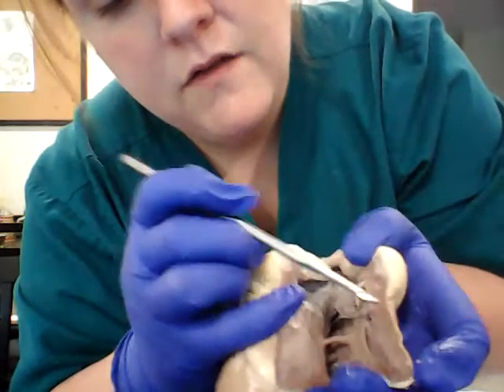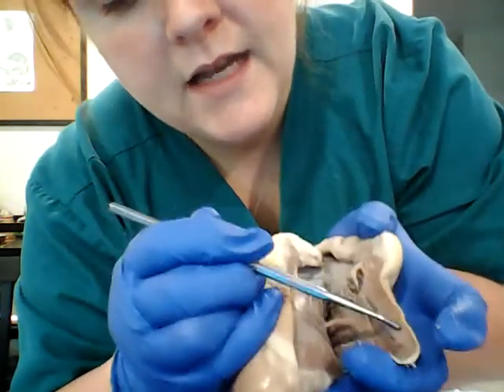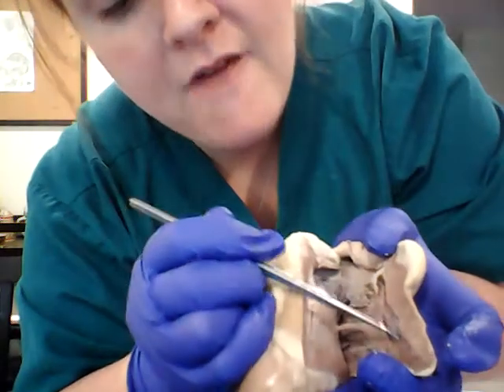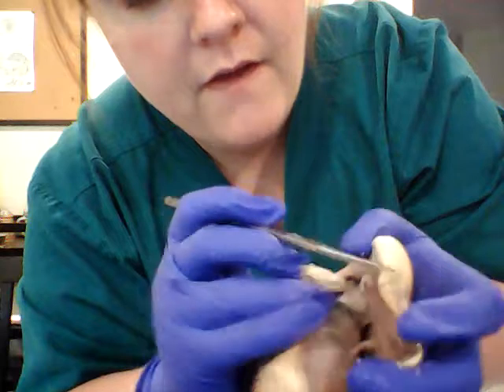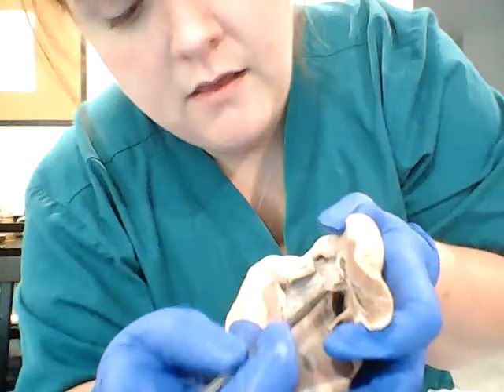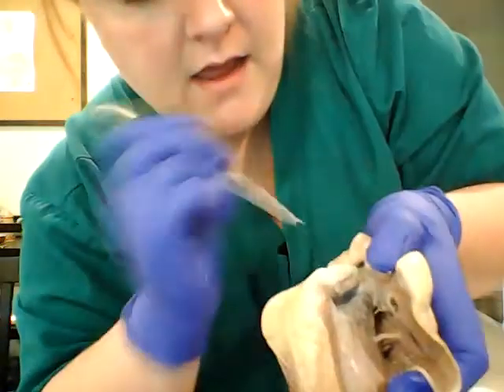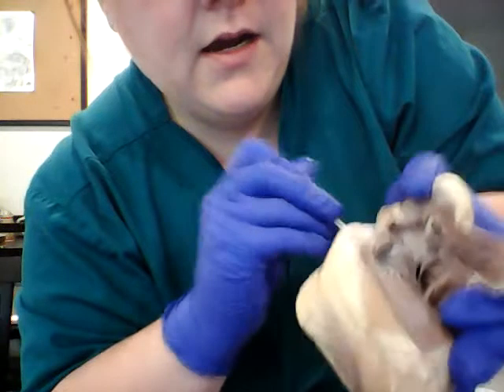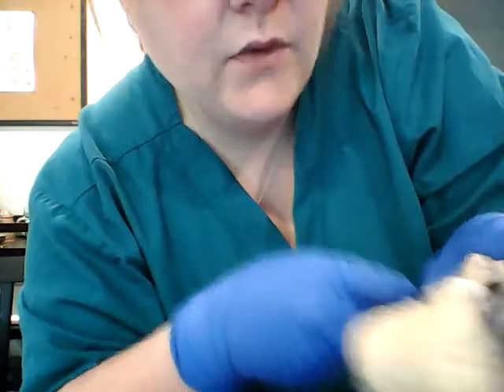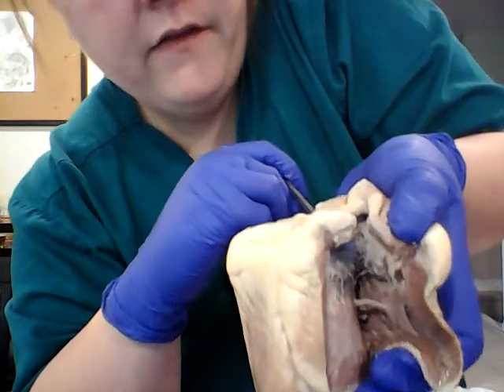The muscle itself, on the outside of the heart, we have our epicardium. And then this section here, we have our myocardium. And then on the inside here, we have our endocardium. And then there's this little valve just past this tricuspid valve here. It's in the back. I don't know if you can see that. If we push this down through, right here, this is going to be our pulmonic valve.